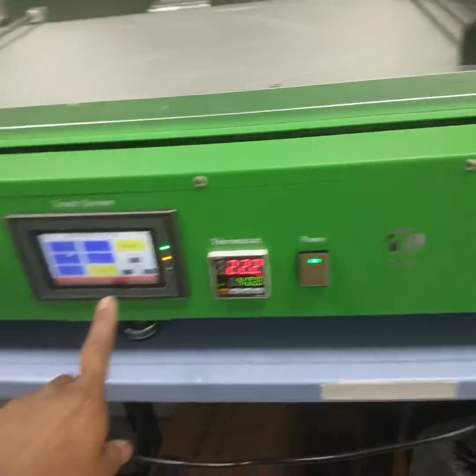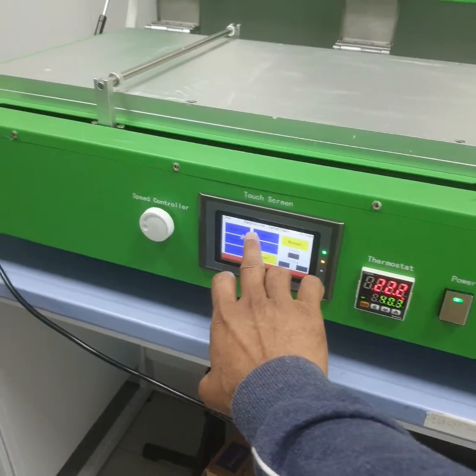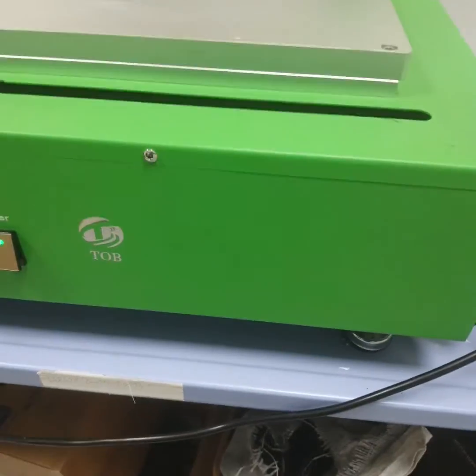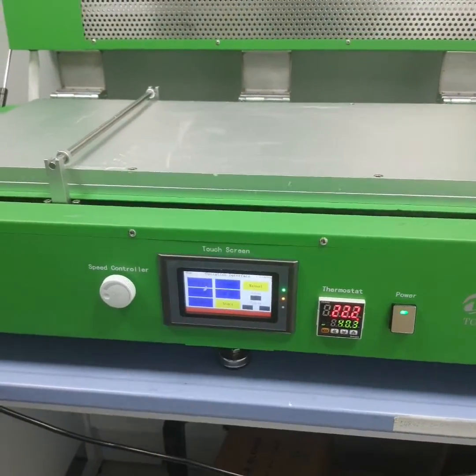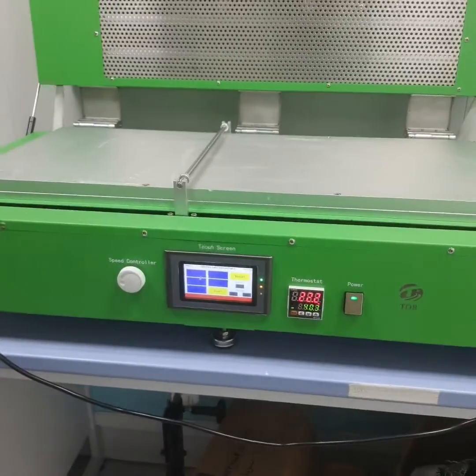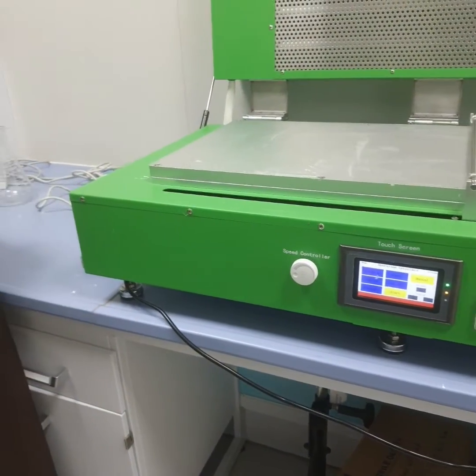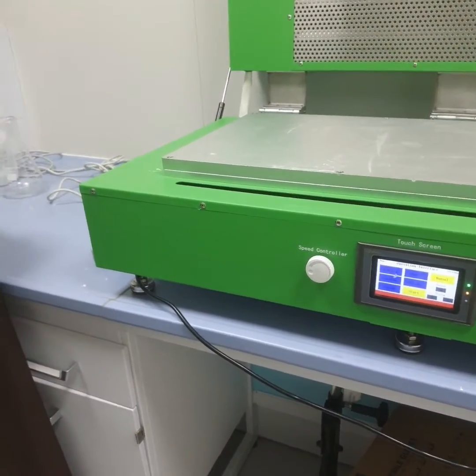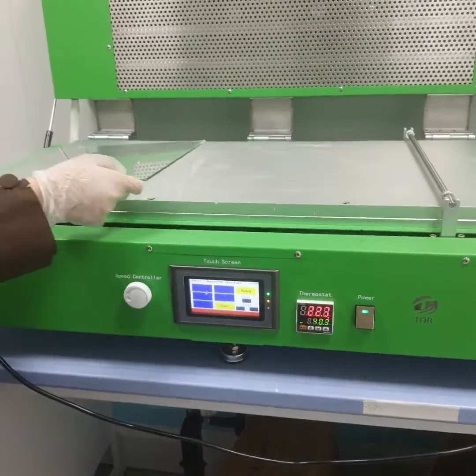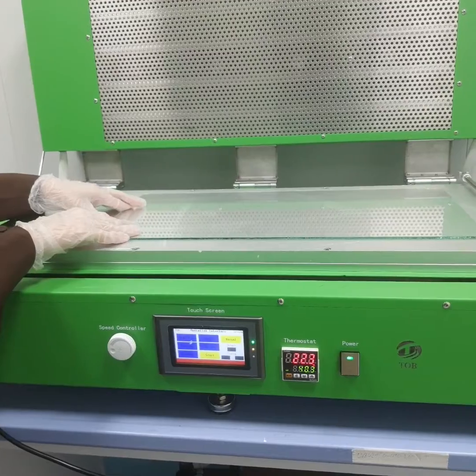First of all, guys, you can see here, switch on the machine. There are certain operation interfaces. You have to reset, and for resetting it has to go to the corners. After that, you will put the dry plate. On the dry plate, you will spread your assortment or mixture. It should be in the middle, not at the corners. So you are preparing the membrane by the technique called phase inversion.